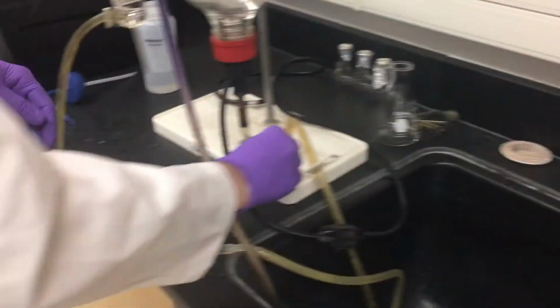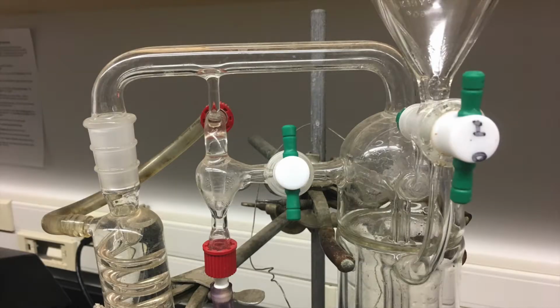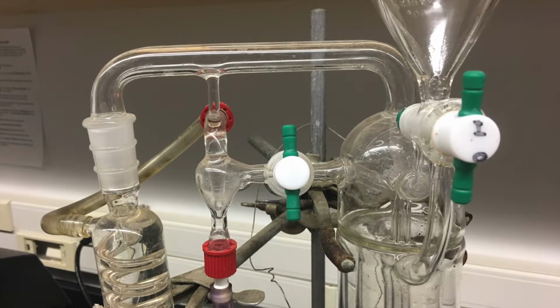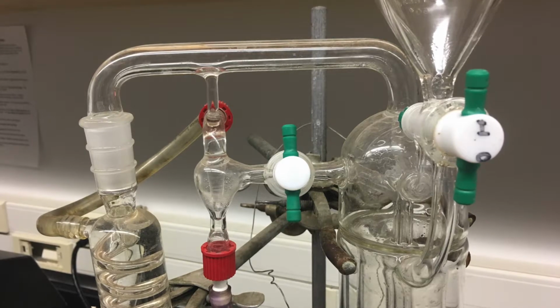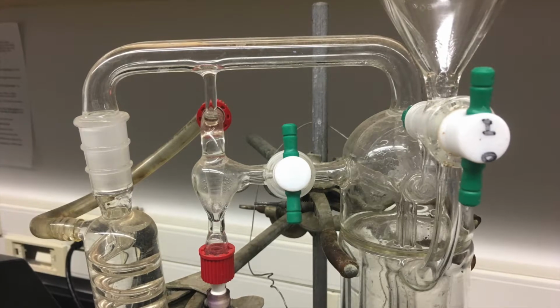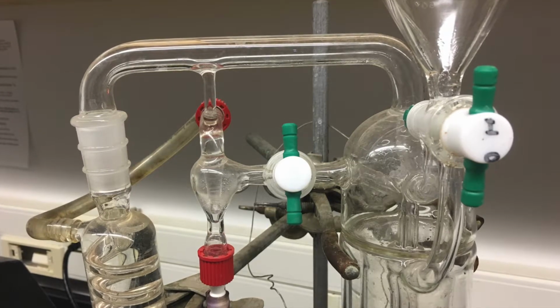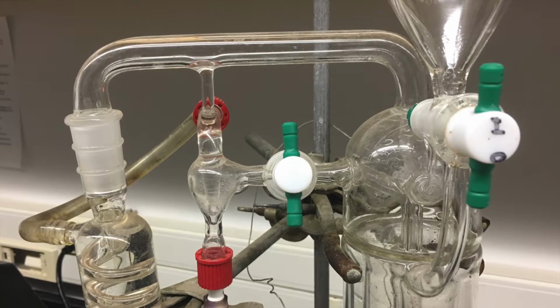Before operating the cash still, make sure all water lines are secure. Take note of both the stopcocks. The stopcock on the right indicates the inner and outer boil chamber. If the I is up, this indicates the solution will enter the inner chamber, also known as the sample chamber. If the O is up, this indicates that the solution will enter the outer chamber, known as the boil chamber.